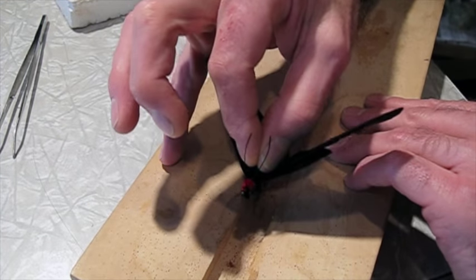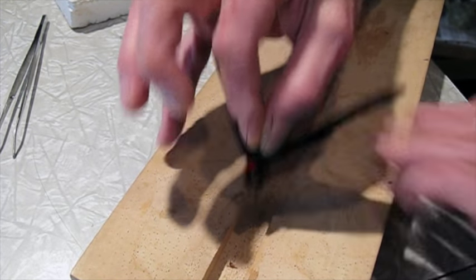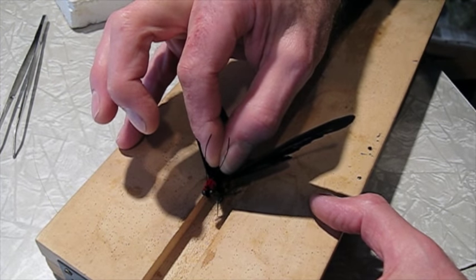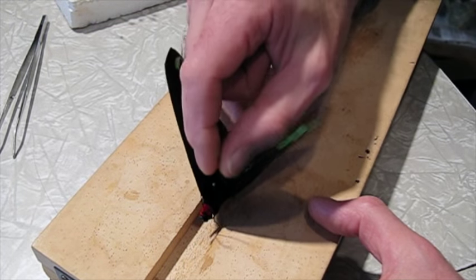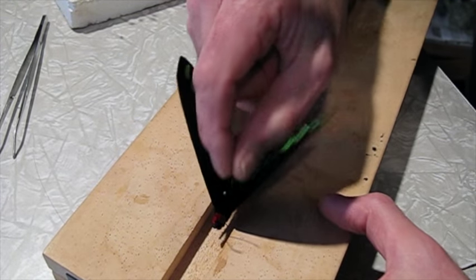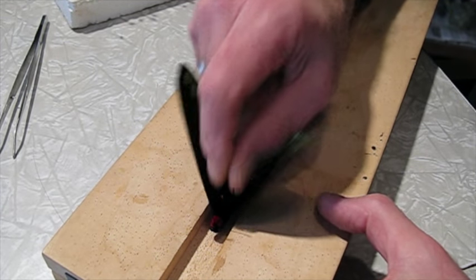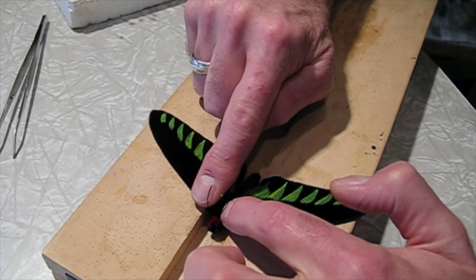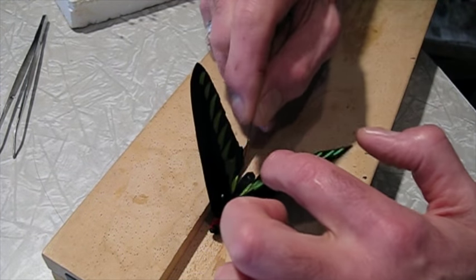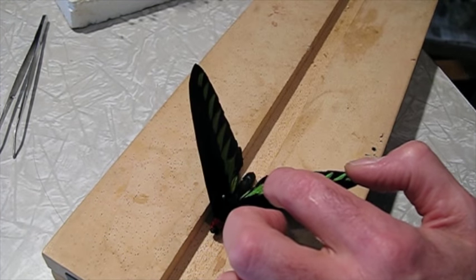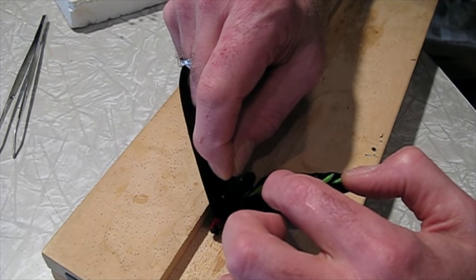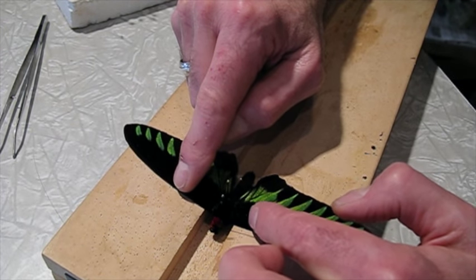Then a quick double check to make sure it's straight. You need to place the pin in the very center of this slot, it makes everything line up better. And then also make sure that the pin is nice and straight, not tilted forward or back or side to side. That looks pretty good. You want it just so that the wings are at the same level as the spreading platform. Now I'll take a large pin and brace the abdomen on each side, because I'm going to be pulling the wings up and that will pull the abdomen, rotate the butterfly on the pin.